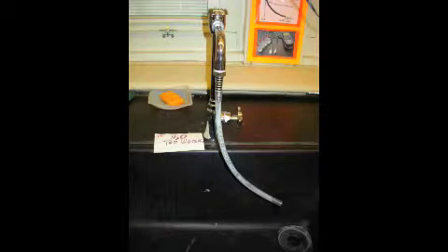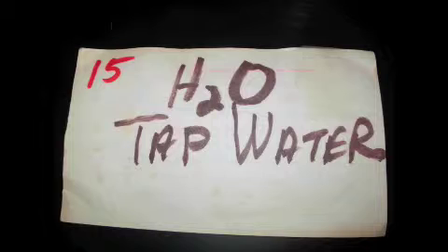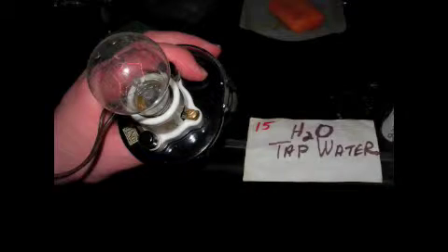Next, we're going to be looking at tap water. As you can see in tap water, we have 2 molecules of hydrogen and 1 molecule of oxygen. So because of this, we see that hydrogen and oxygen are both nonmetals and that they will not be conducting electricity. However, as you can see, there's a small amount of illumination when we place the light bulb into the tap water. This is most likely because of the small amount of calcium carbonate which is present in the tap water. So the water is in a covalent bond, however calcium carbonate is in an ionic bond.